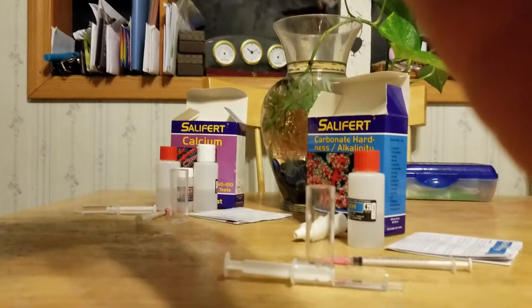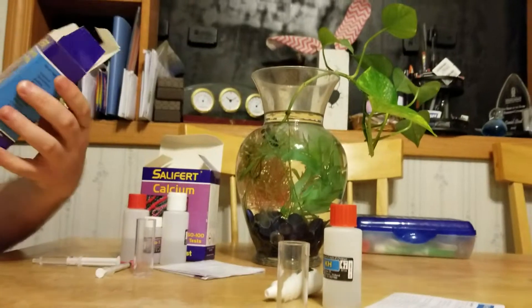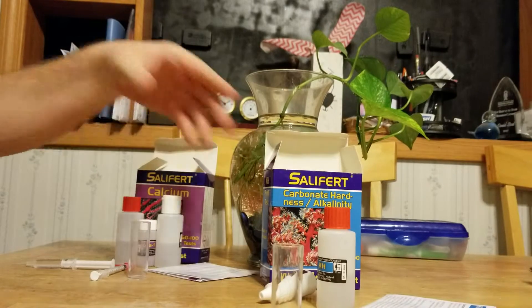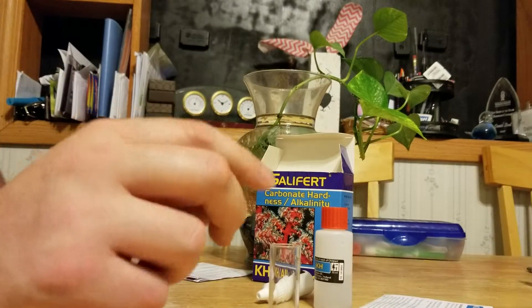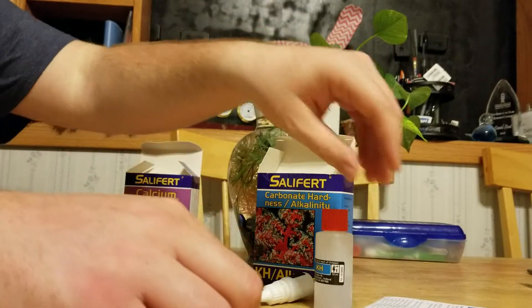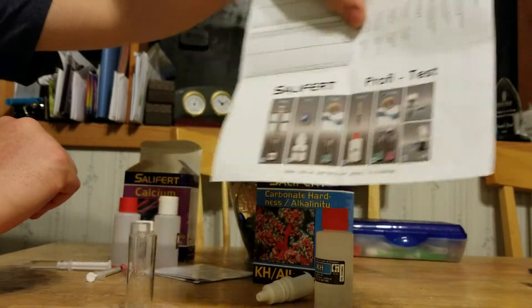Hey YouTube, we're going to do some water chemistry here. We got a Salifert alkalinity test and also a calcium test. We're gonna run both. We'll start with the alkalinity — I've done this a few times. It gives you nice instructions right here, so we'll walk you through those.